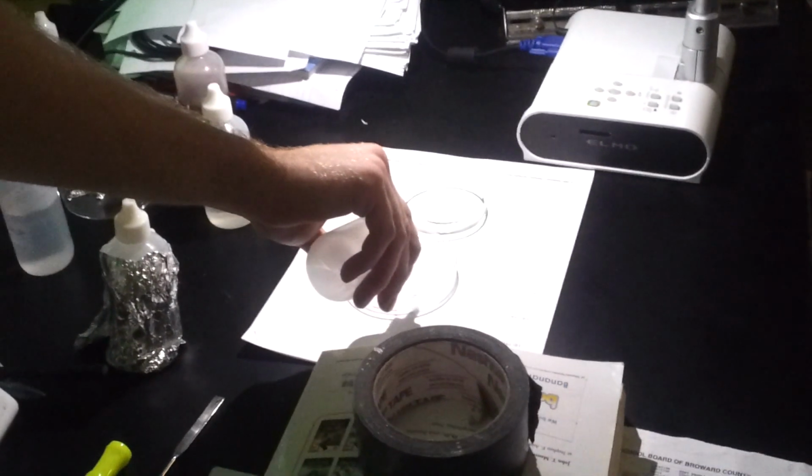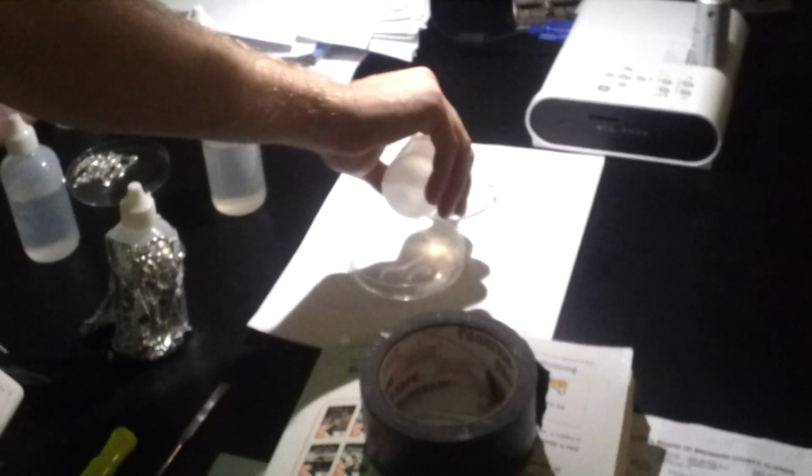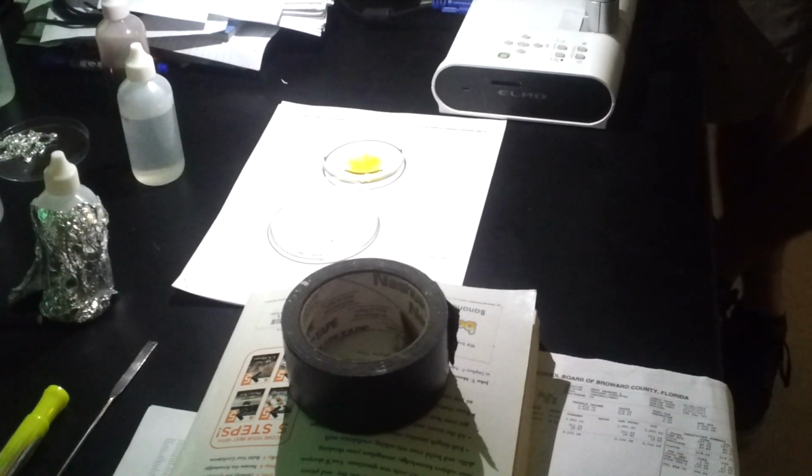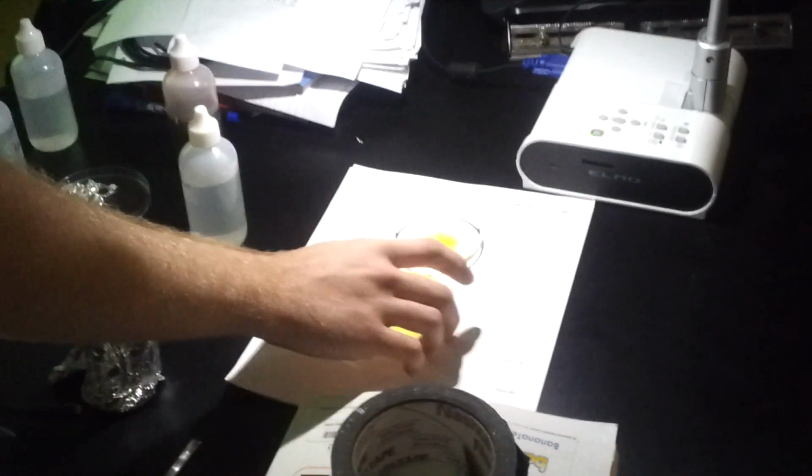You guys see that on the screen? It looks like an amoeba. That's just the liquid right now. So you can see it forming on there, but I haven't mixed this one on the right yet. So we just have to mix it until the bromine goes away, and then we're going to add the indicator because the bromine destroys the indicator.